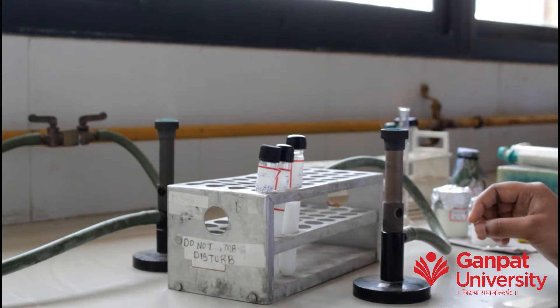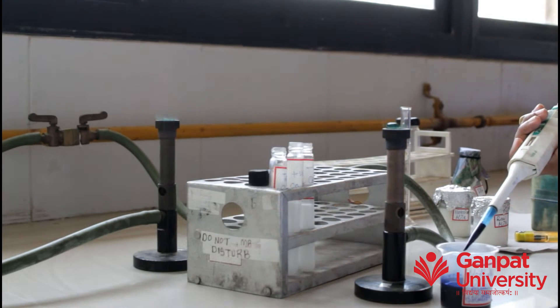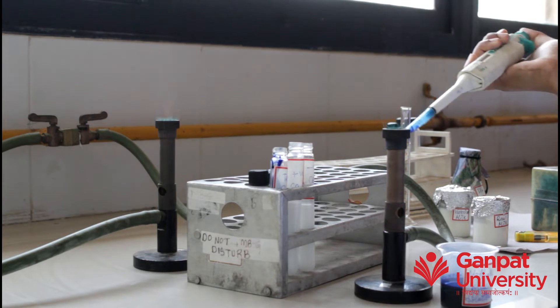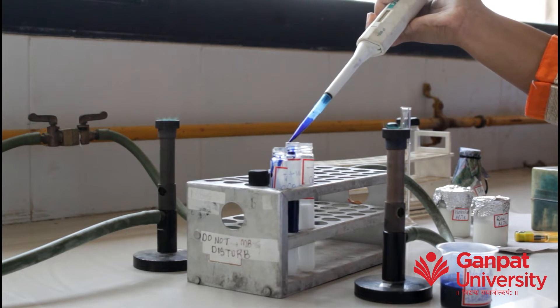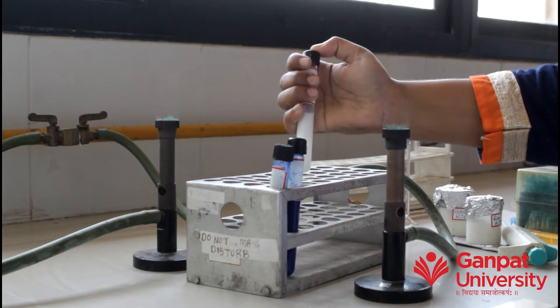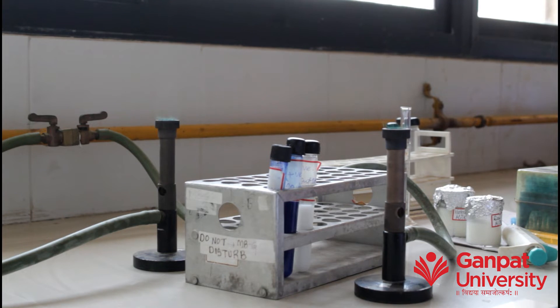Add 1 ml methylene blue dye to the tubes — 1 ml in the test sample tube and another 1 ml in the positive control tube. Close the screw caps, mix by inverting once and twice, then place all three tubes in a water bath at 37 degrees and note down the time.